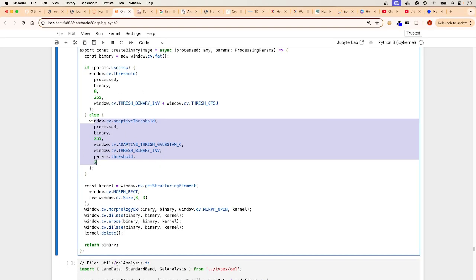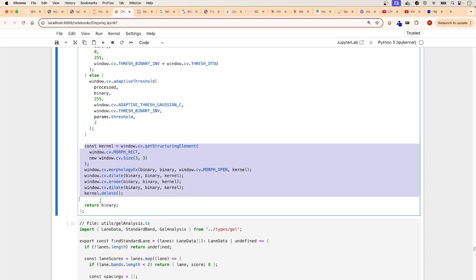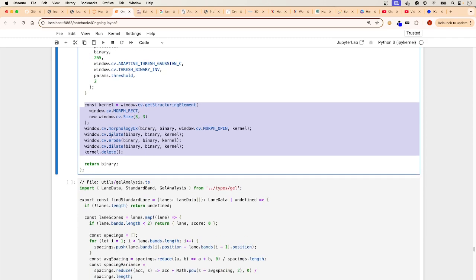After it does all that, then it applies more morphological filters of erosion and dilation to clean it up, to make the image look a lot better. And that's what's happening there. So basically, it makes the bands more defined.